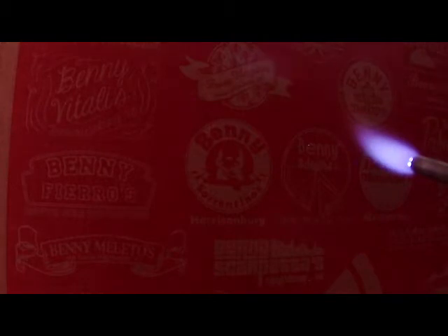Now you might ask, again, why am I using the little mini torch? Bring this down a little bit. It's simply because I haven't used the mini torch in about a year. So I decided to pull it out of mothballs and use it for this project because 3 millimeter borosilicate rod should be very easy to work with this little torch, and it is. I really haven't used this mini torch for too many projects, but it's on my list of several things I'd like to do. Now, my square is not perfectly squared, but I'm okay with that.